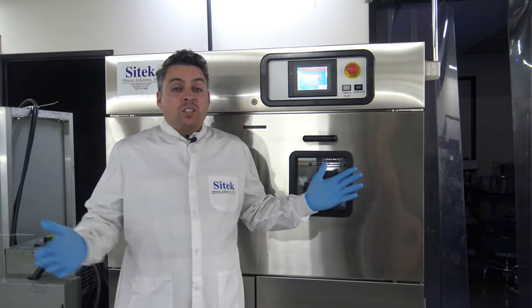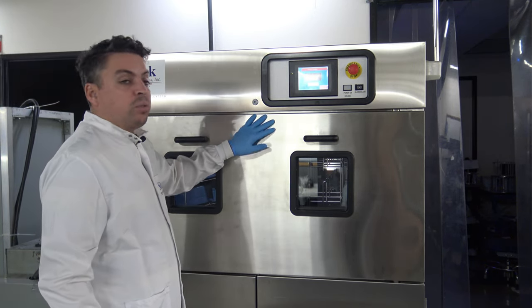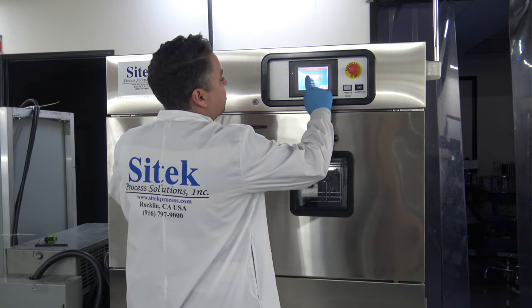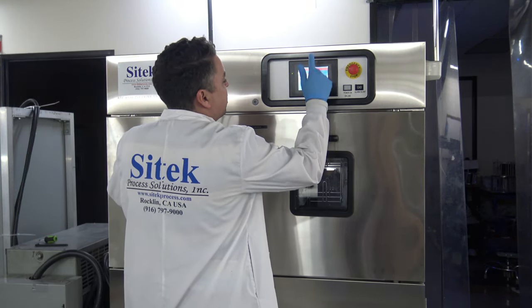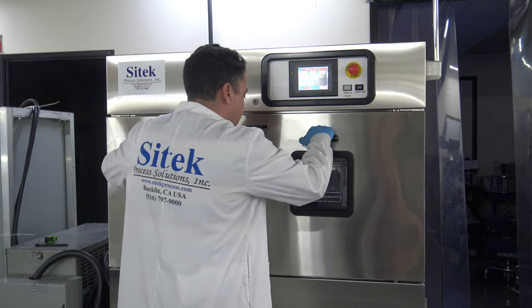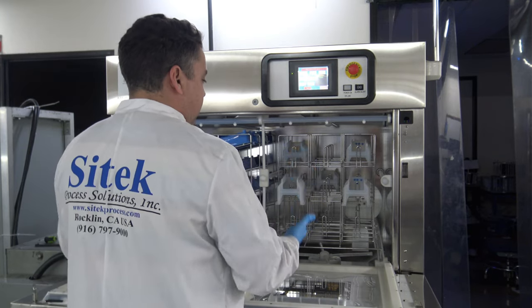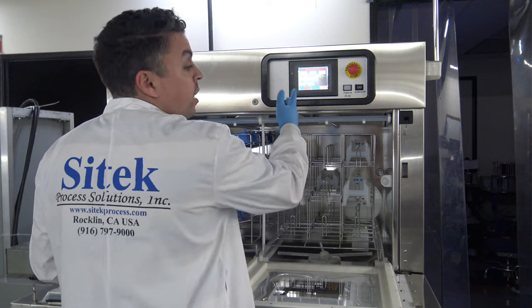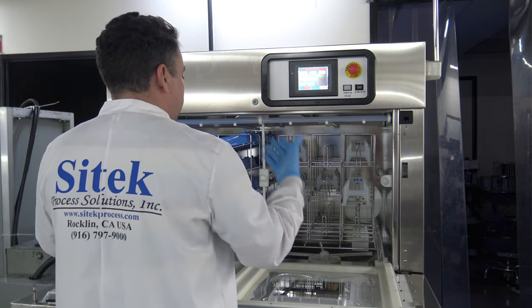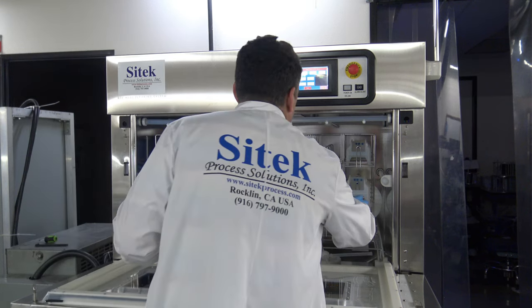And we're back. We have just had a successful completion of the wash and dry process for the box washer. Our next step is acknowledging the finish. The door seal has now released. Opening up the chamber, I can feel the heat coming out of it. There's an automatic two-minute timer that delays before the end of any run, but you'll still feel the heat — it's pretty clear when a process run has completed.